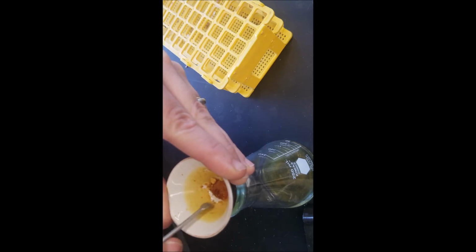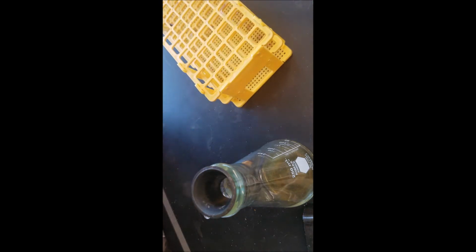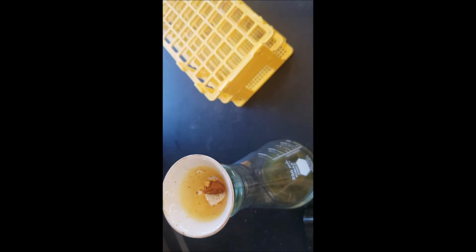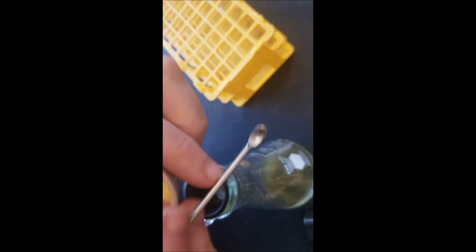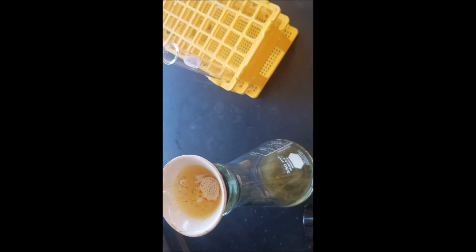I'm gonna go ahead and extract even the filter paper into this tube to remove the catalyst. I know they're far from ideal, but it is what it is, and it is after drying for 2 days. After I have this as much into this test tube as I can, I'm going to add some acetone. So I'm going to do that in the next few minutes.